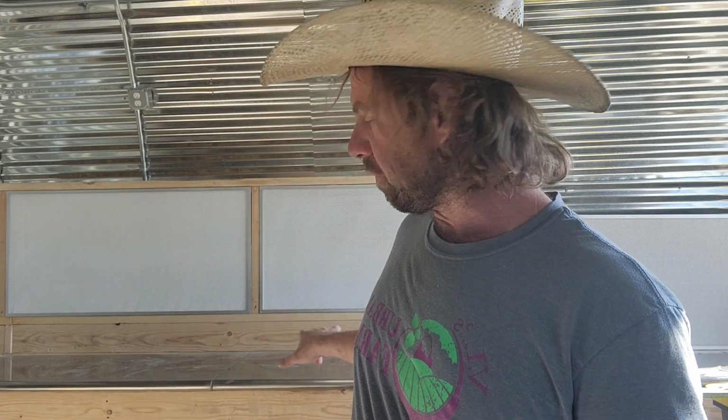Now I'm not going to go over the full construction of this in this build. I'm going to save that for later. I still have a few adjustments I need to make on my pre-filter thing before I want to put up the full video on that. But since this thing is flowing adequately, I felt this was a great opportunity just to show how you can test one of these things and make sure you have adequate airflow coming out of them.